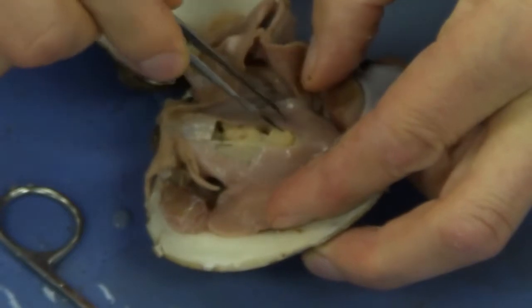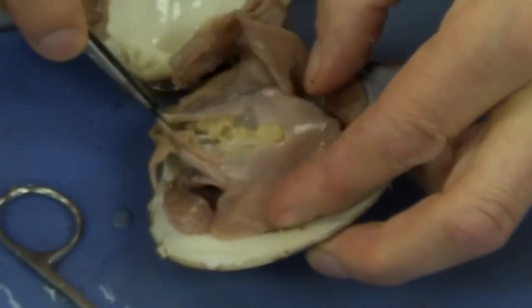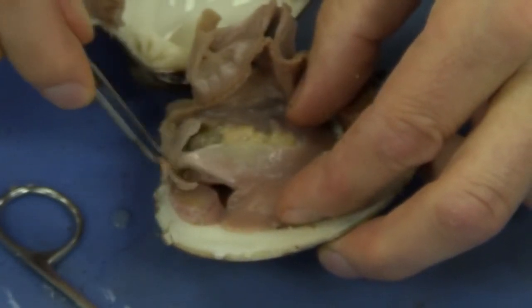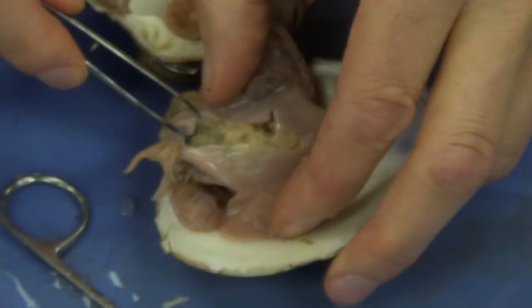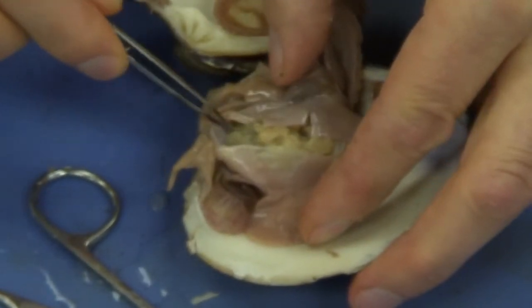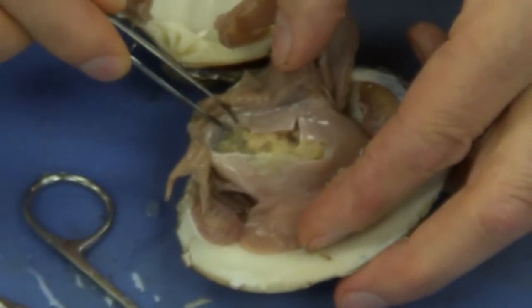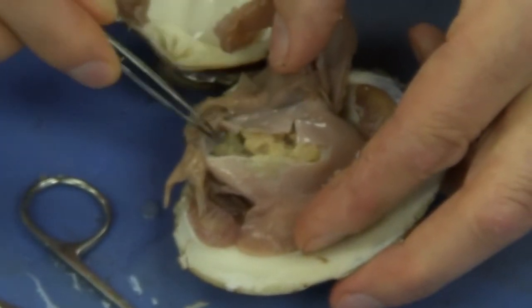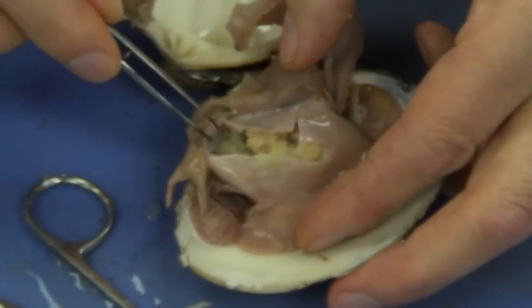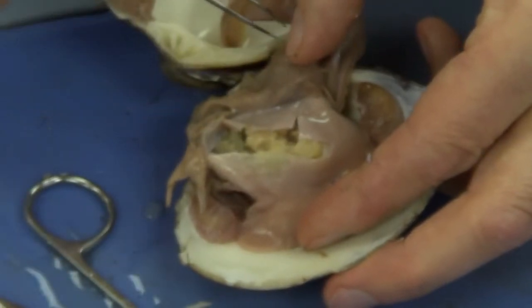We can see more of that yellow structure. All that is gonad. And then over here, you can see a darker colored structure. There we go. A green structure in a sense. You can see it right here. This green structure is the digestive gland. In terms of texture, they look very similar, but in terms of color, there is a definite color difference. Green, the digestive gland, versus yellow, the gonad.